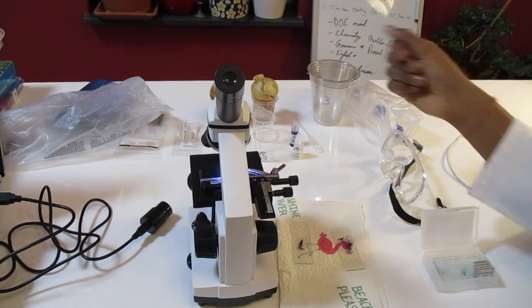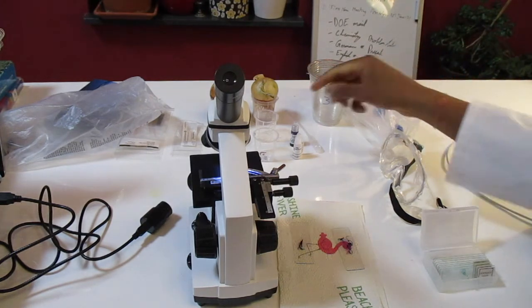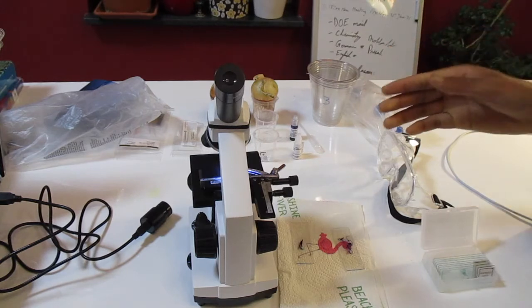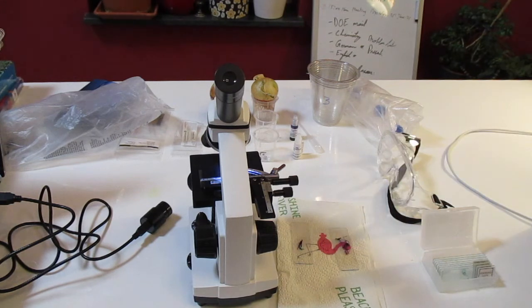We then dried it up. So after placing it in HCl, we left it to dry, and once it was dried up, we added 5 drops of toluidine blue to each of the roots and left it to dry again. And that's when we used the squash technique here on the slides. In the squash technique, the slide was placed on a paper towel cushion, and the slide and the cover slip were covered with the paper towel. Then, using the eraser of a pencil, the section with the root tip was pressed hard straight down without bending or rotating it.